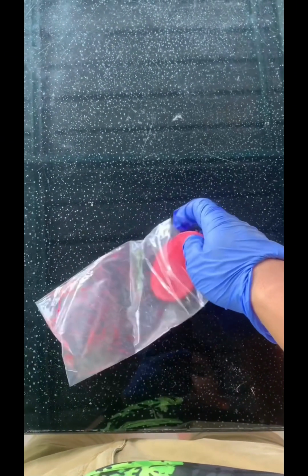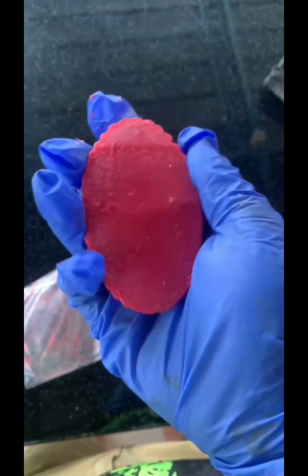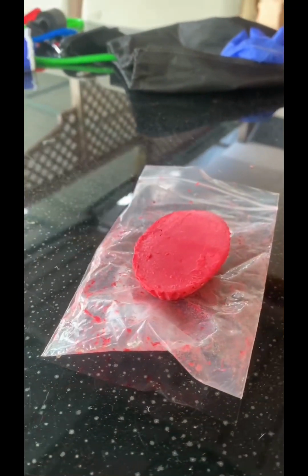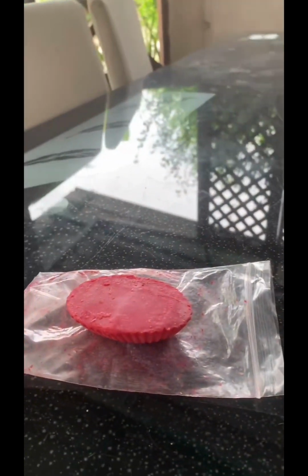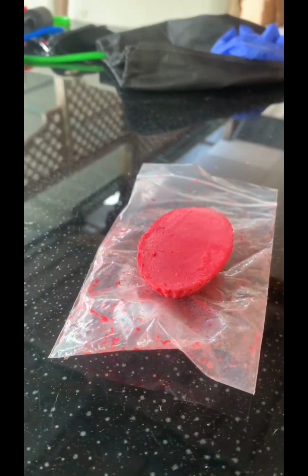After a few days left at room temperature, homemade soap textures can vary based on the ingredients, but often they have a smooth and creamy feel. The consistency depends on factors like the oil used, such as coconut oil. Some may be more moisturizing, creating a luxurious, silky texture, while others might have a firmer, exfoliating feel if an additive like oatmeal or herbs is included. Overall, the texture is a very delightful blend of nourishing and cleansing elements.